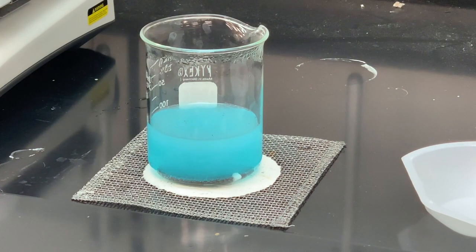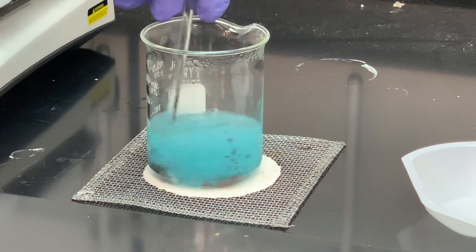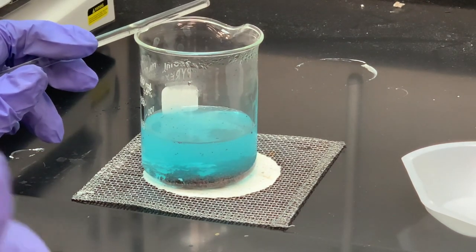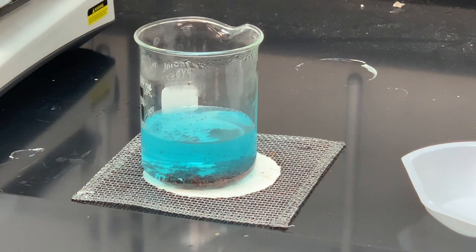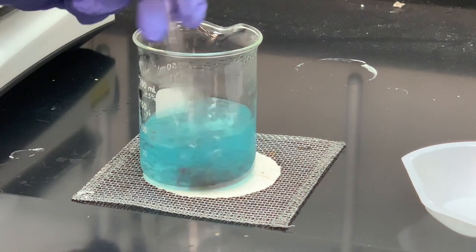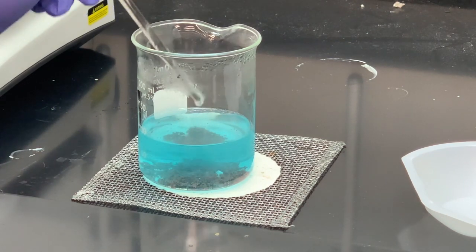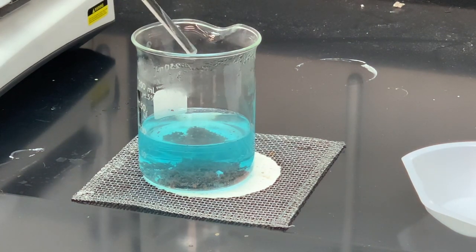Then we'll transfer our copper to an evaporating dish. The first question in your lab book asks about the limiting reactant in this particular reaction. Your two options for the limiting reactant are copper sulfate — the blue solution — and the zinc. Think about how you can decide what is your limiting reactant. That's going to be by observation, not by calculations, for this first question in your report sheet. Remember, the limiting reactant is completely consumed in your reaction.